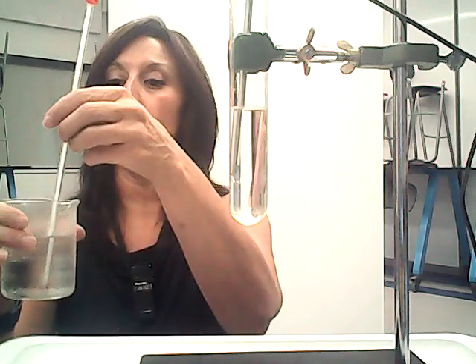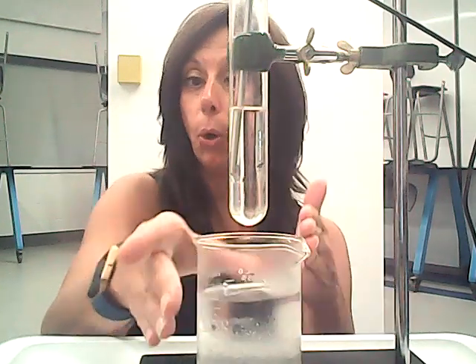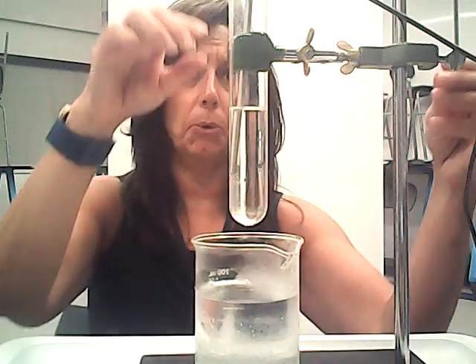Before I start, I do have a little beaker of cooler water here, and I've got a thermometer in there, and the temperature of this water is just about 7 degrees, so it's just above freezing. The freezing point of water is 0 degrees Celsius, and this is about 7 degrees Celsius, so it's above freezing. It's cold. I can feel it's cold. You can see the condensation on the outside. The room is pretty warm, actually.